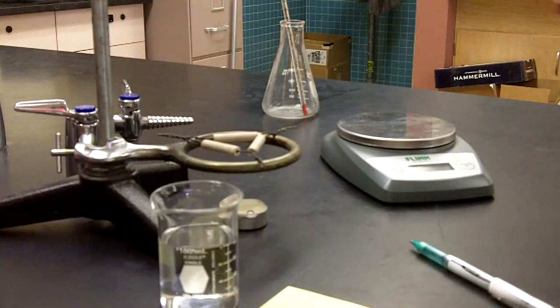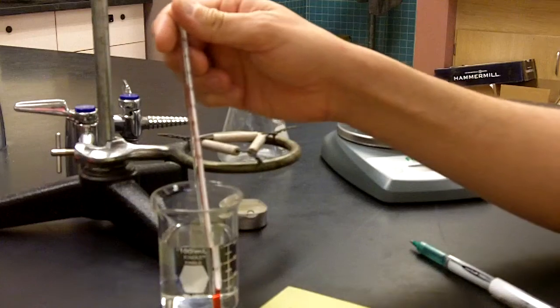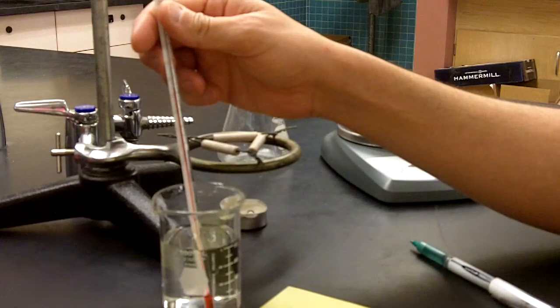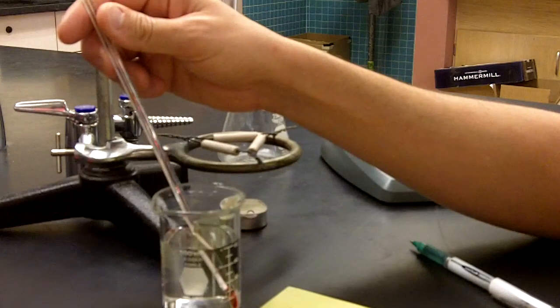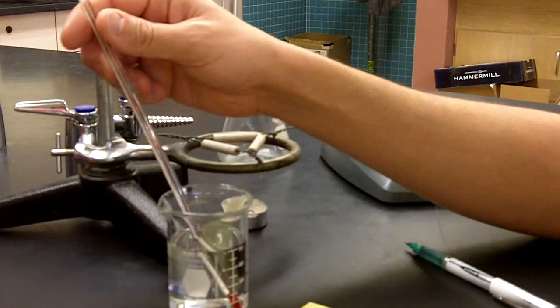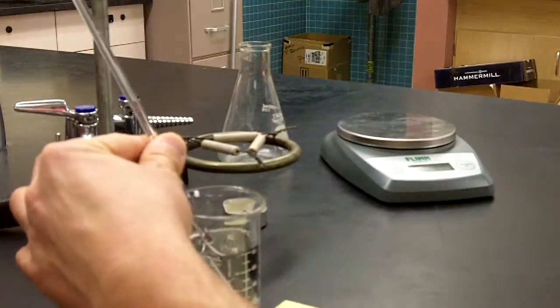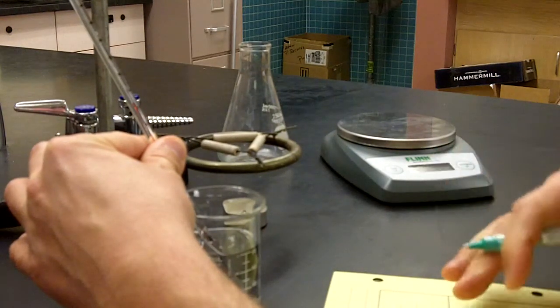Now we have to measure, to the nearest 0.5 degrees Celsius, the temperature of the water as indicated in step 3. So I have this flask with this thermometer in it. I'm just going to put that thermometer into the water. Of course, the temperature of the room is what the thermometer was reading, and the water is close to, if not right on, that room temperature value. It looks like we have a pretty stable reading for our thermometer, and we want to record this temperature as the initial water temperature: 23.0, and that'll be degrees Celsius.